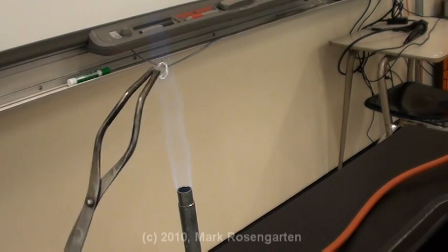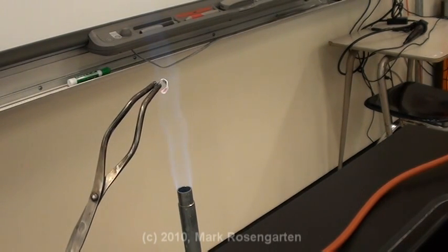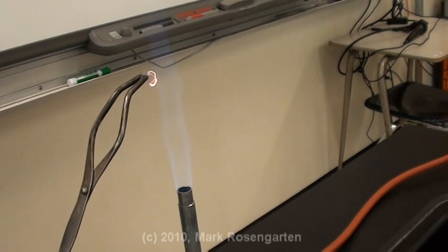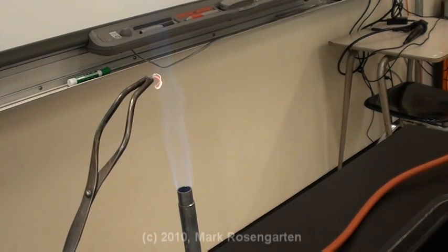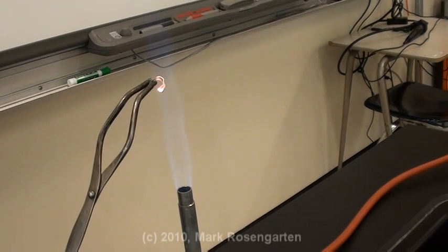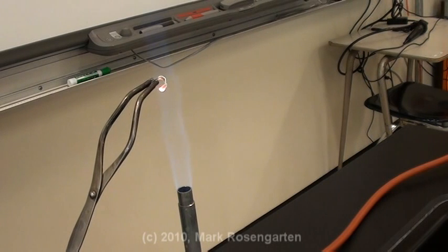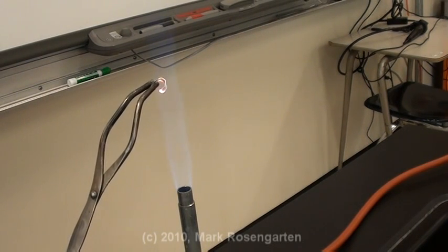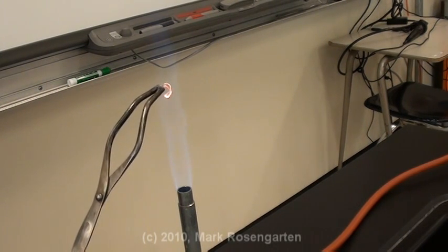Now of course, when we take this magnesium oxide and try to react it further, you'll notice that it doesn't react at all. Magnesium oxide is stable. Magnesium's got a stable octet. The oxygen's got a stable octet. Therefore, it has no further reason to react. The energy that we just added was your ionization energy. The energy it takes to kick those electrons out of the magnesium so that oxygen can gain them.